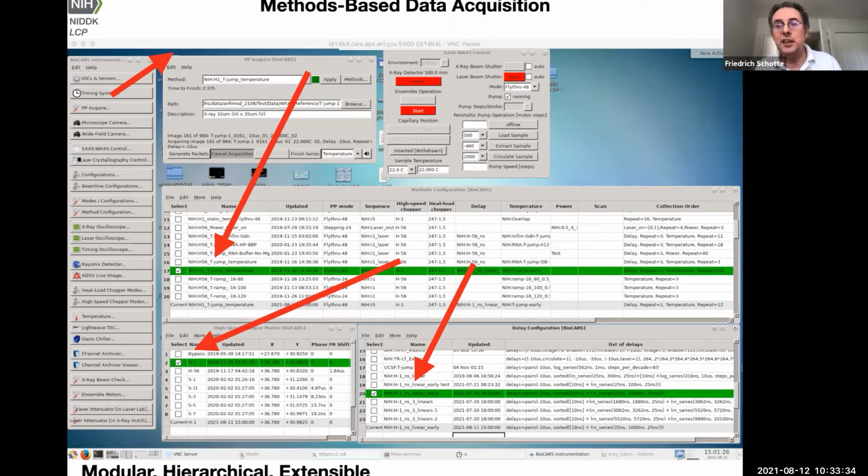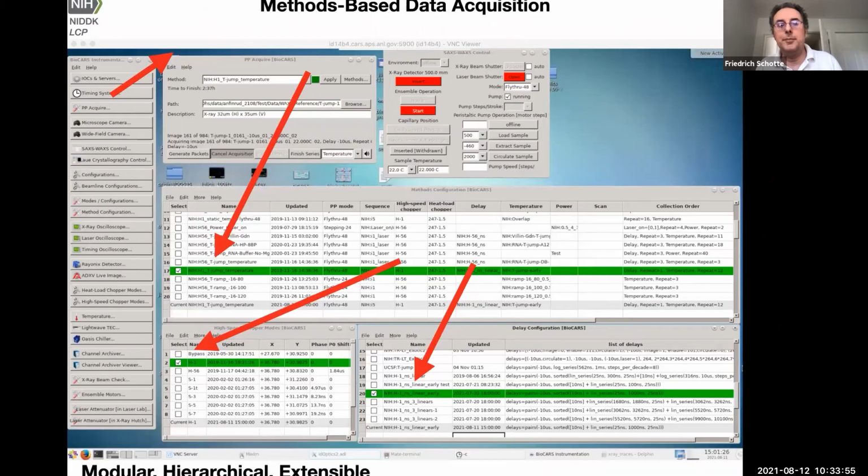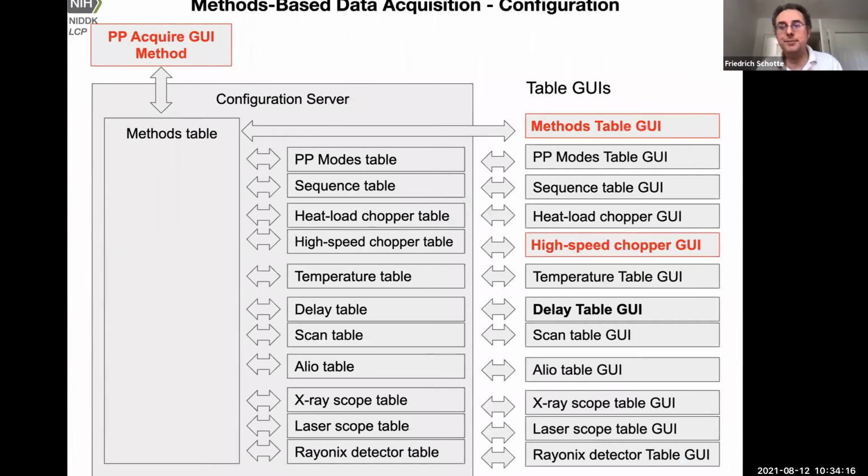So I wanted to show you what is the architecture behind this software. You see here, this is the PP Acquire GUI, and there are the table GUIs here, like the high-speed chopper and the methods table. So there is an infrastructure behind it. The panels don't do anything. They are just user interfaces for servers that run in the background, or as they call them at the APS, input-output controllers, IOCs. So for the configuration, there's a configuration server that has internal tables, not shown on the screen, that link to table GUIs. You can edit or make changes, or you can inspect.